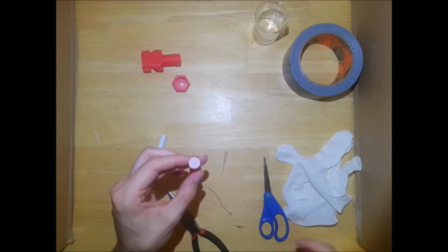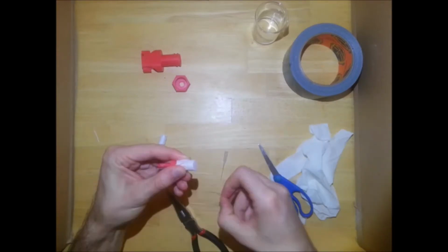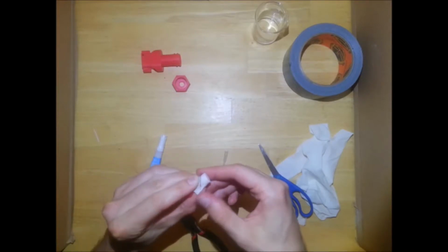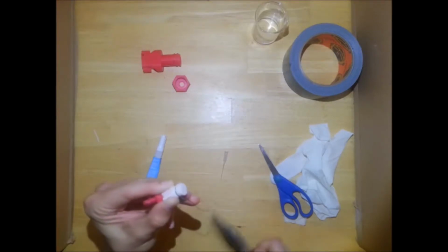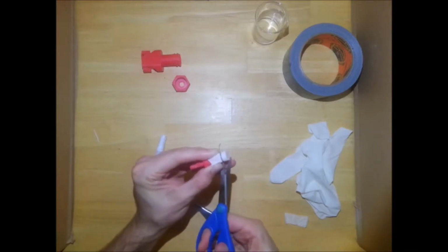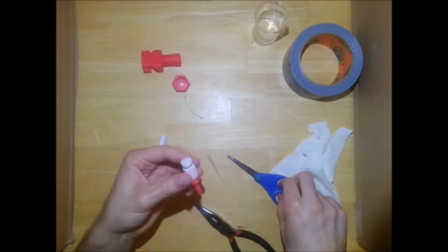Once that's done, you want to go ahead and add a second layer. Again, you want to make sure this top part is flat. Wrap the wire around. And then trim the rest.